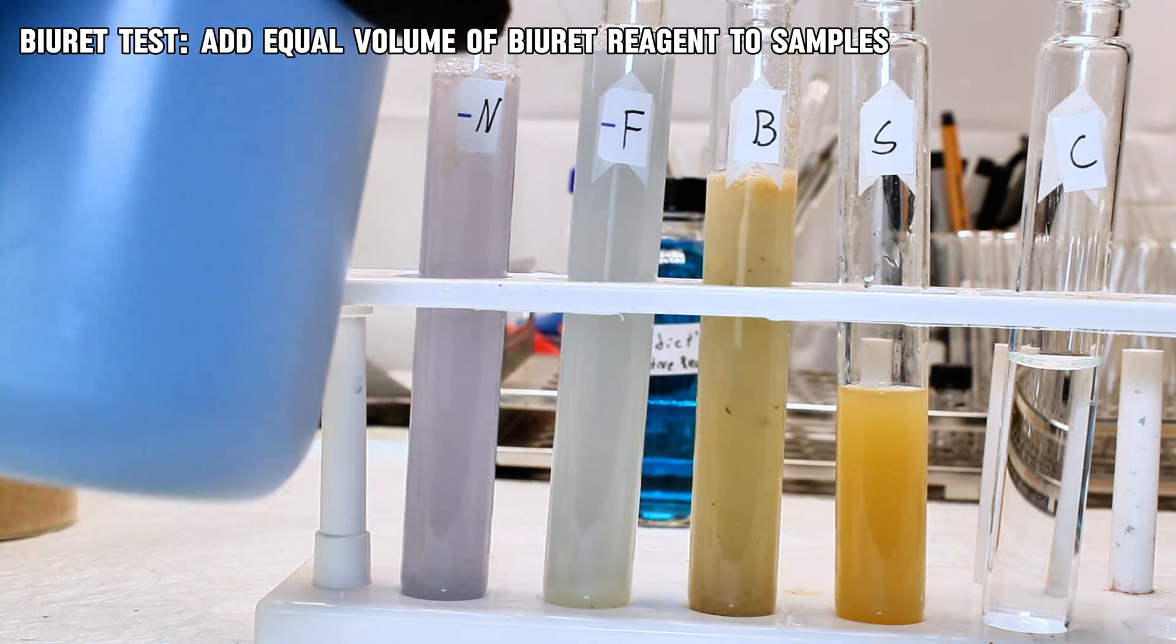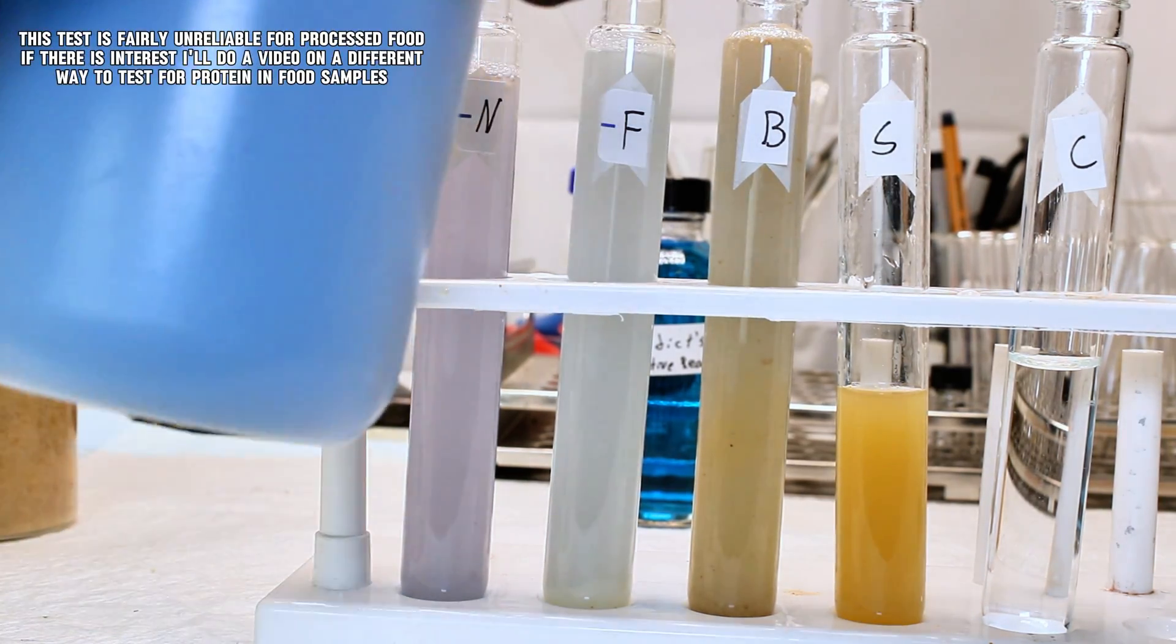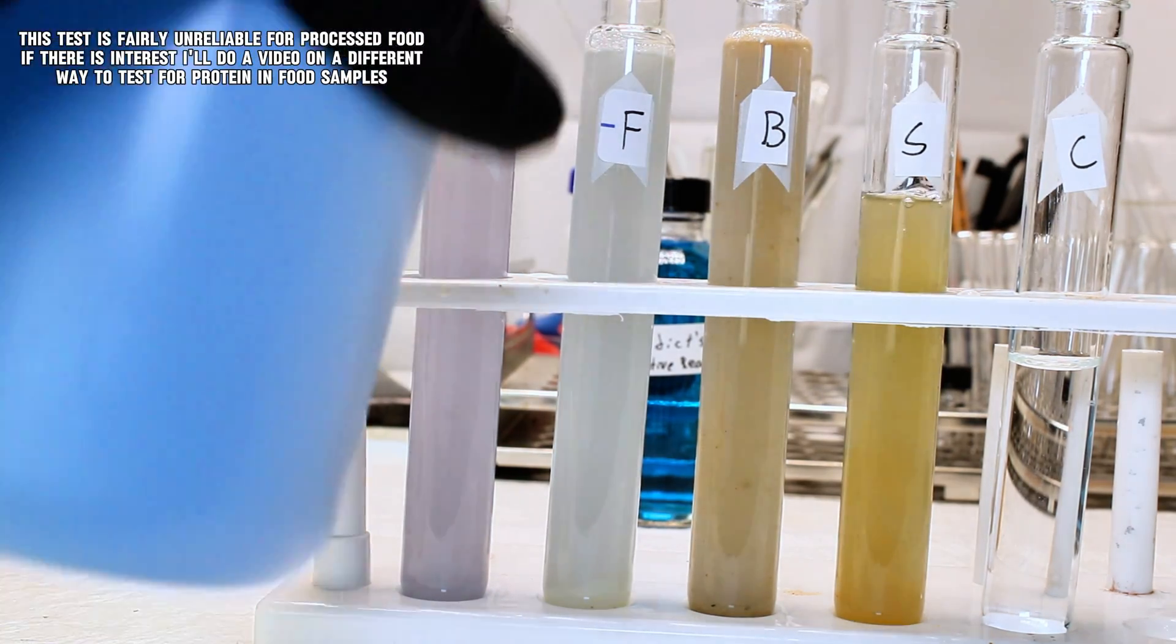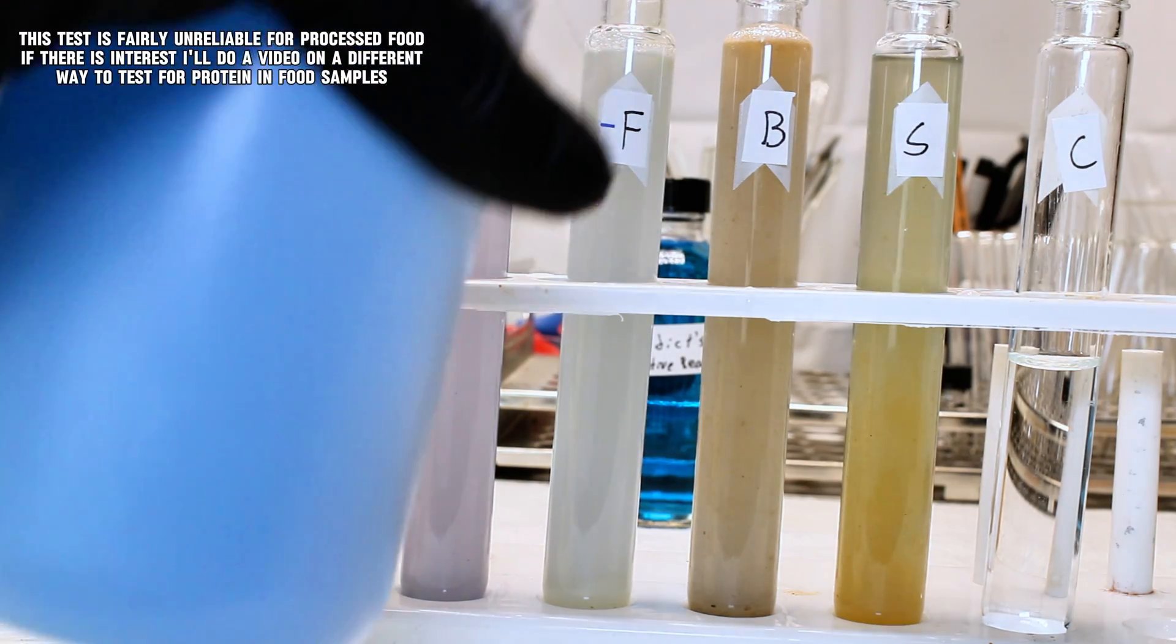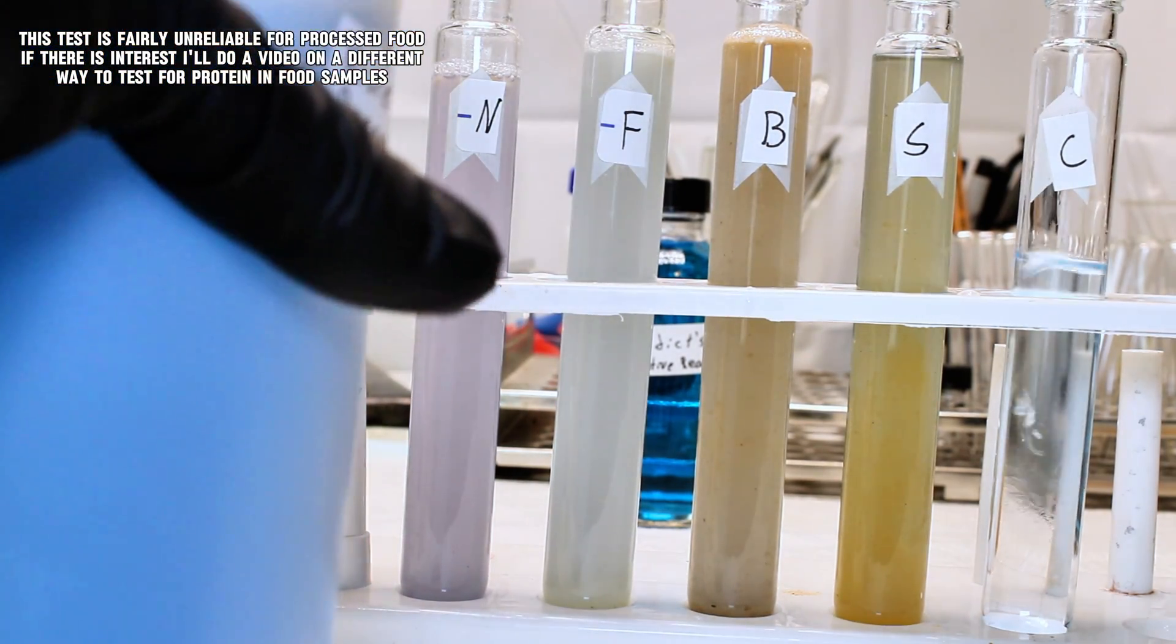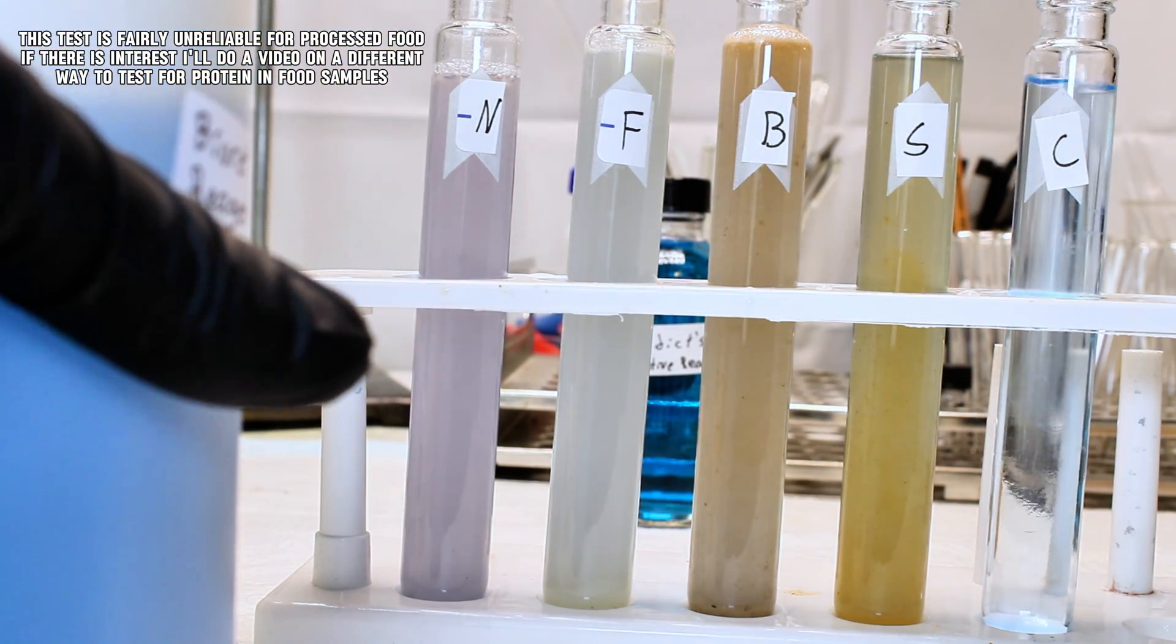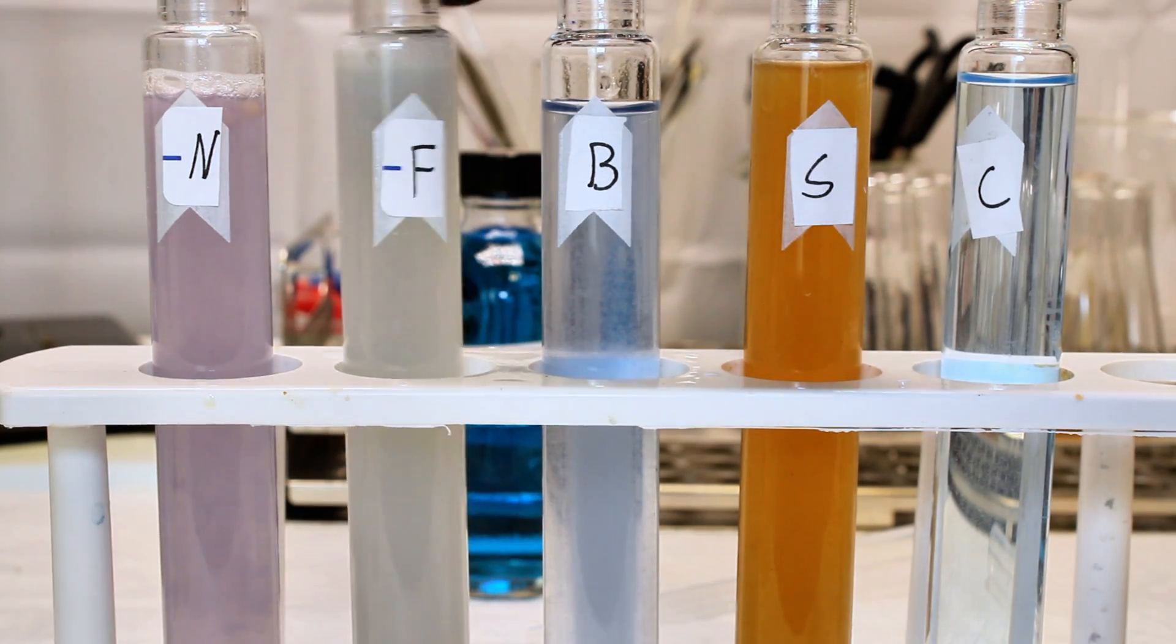However, the color was a lot more faint than I'd expect considering these nuggets are mostly protein, hopefully. And as I said earlier, any additive chemicals could interfere with this test, as could the cooking process itself in denaturing proteins and rendering them less soluble. Regardless, it was definitely a positive result qualitatively, just maybe not quantitatively.